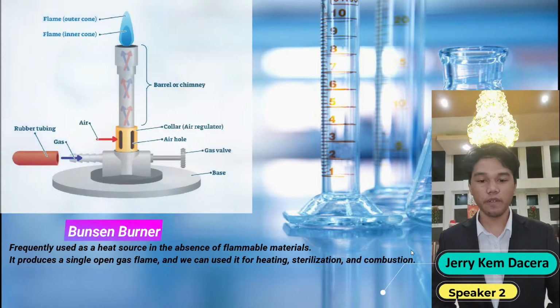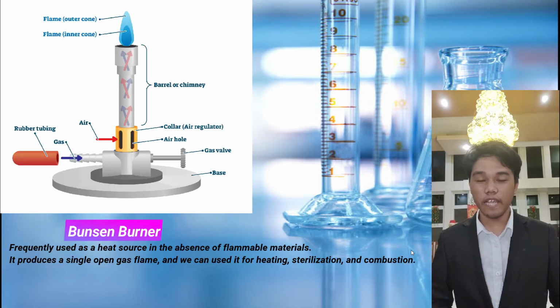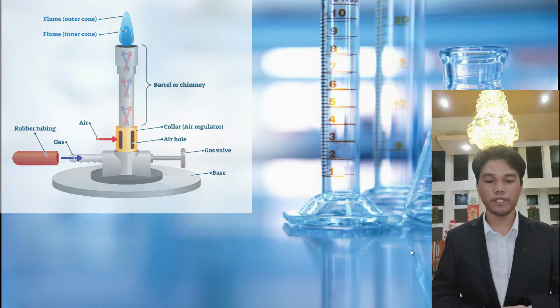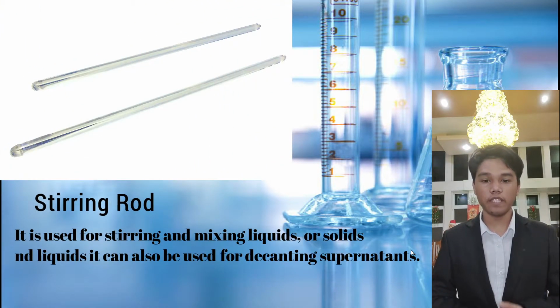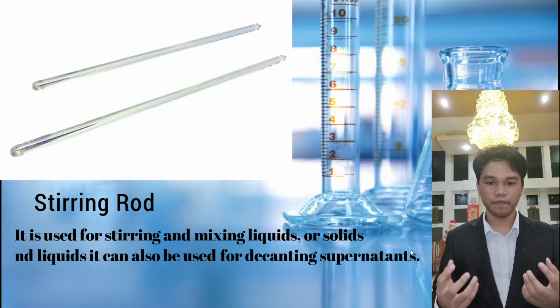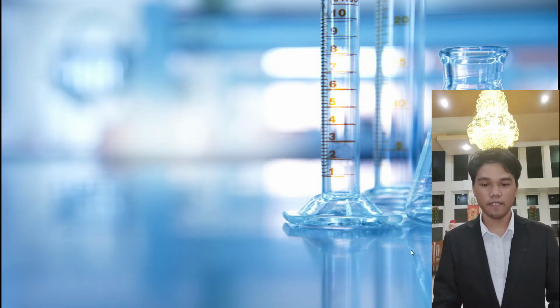Bunsen burner. It is frequently used as a heat source in the absence of flammable materials. It produces a single open gas flame, and you can use it for heating, sterilizing, and combustion. Next is stirring rod. Stirring rod is used for stirring and mixing liquids or solids and liquids. It can also be used for decanting supernatant.